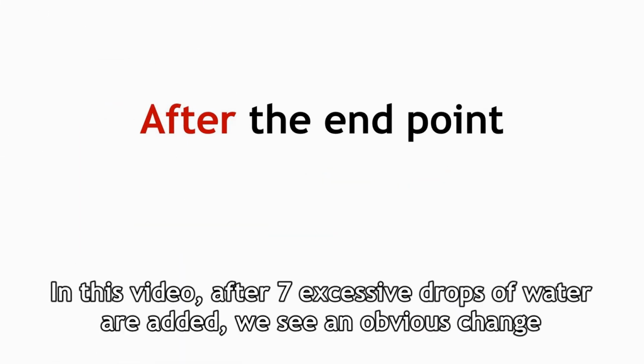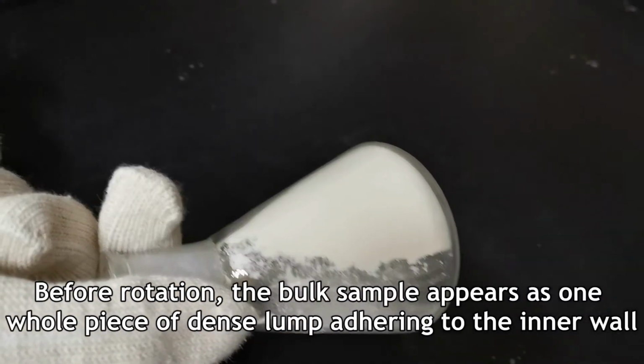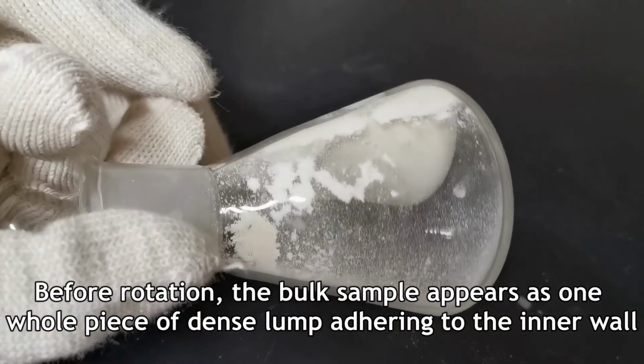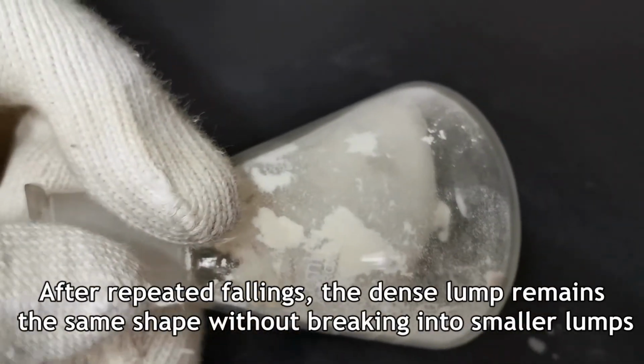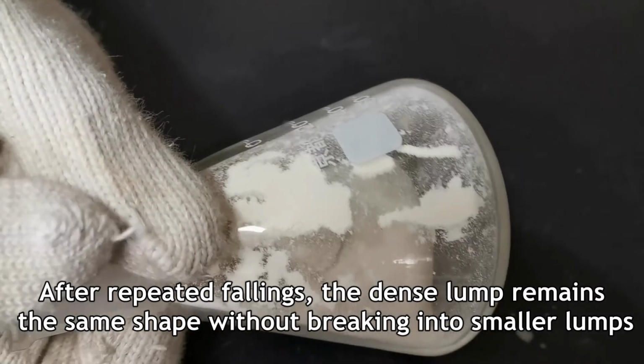In this video, after 7 excessive drops of water are added, we see an obvious change. Before rotation, the bulk sample appears as one whole piece of dense lump adhering to the inner wall. Rotate and tap the flask, the dense lump falls. After repeated fallings, the dense lump remains the same shape without breaking into smaller lumps.